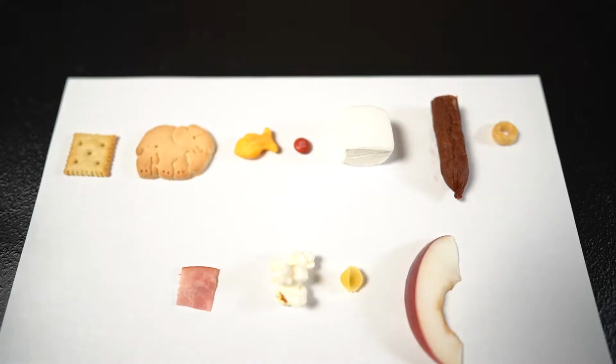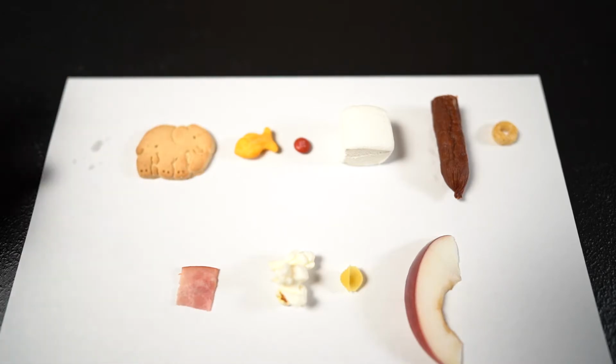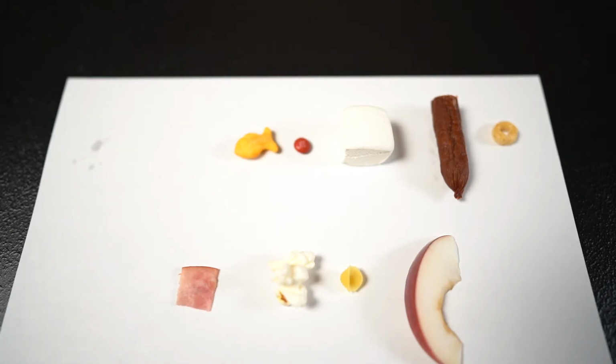So we'll do the same thing by leaving our food on a white sheet of paper, and we're just gonna monitor it and see if it gets that oily shine to it. And that will be our fats test. We'll put it into a chart, and we'll see what we can feed our king and queen of the town. It just smells like smoked sausage down here from that stuff.